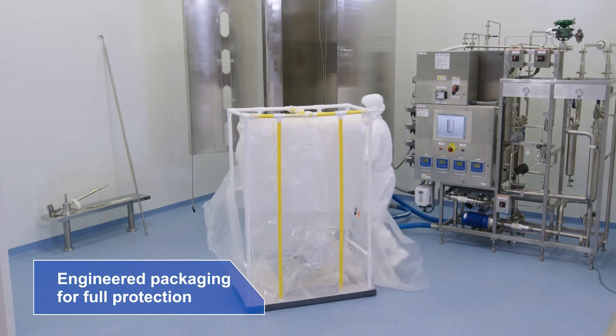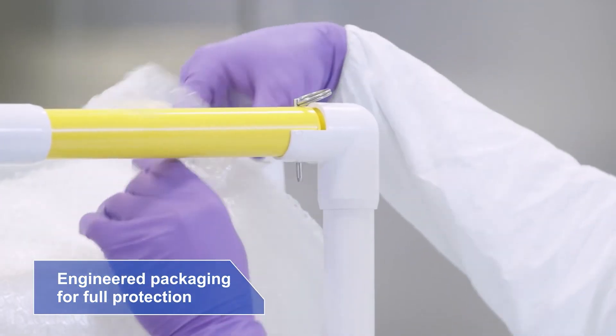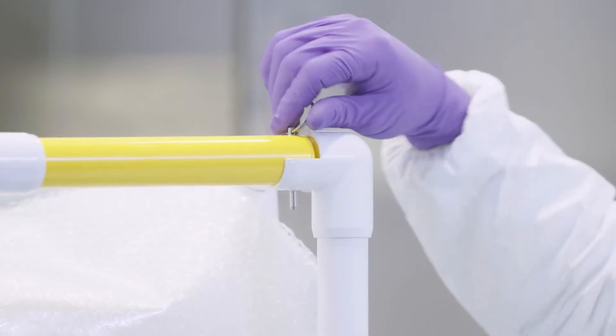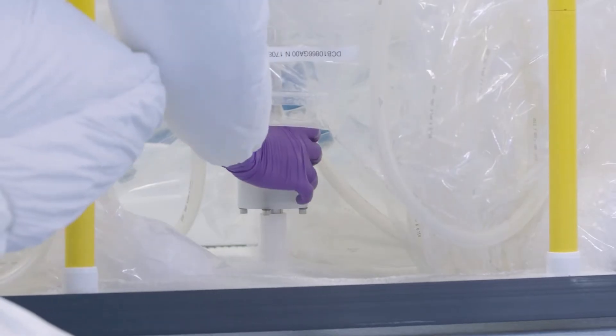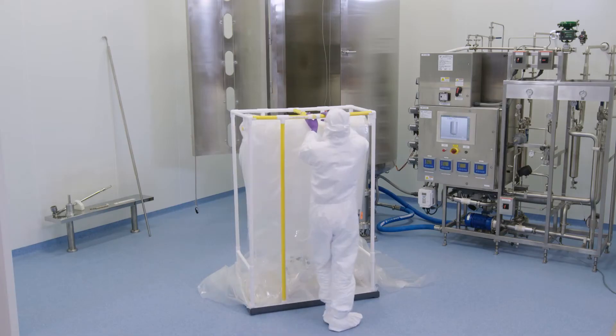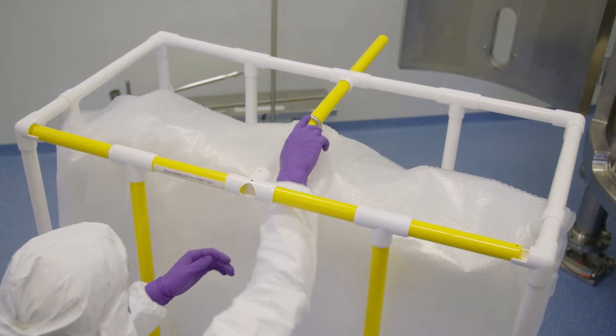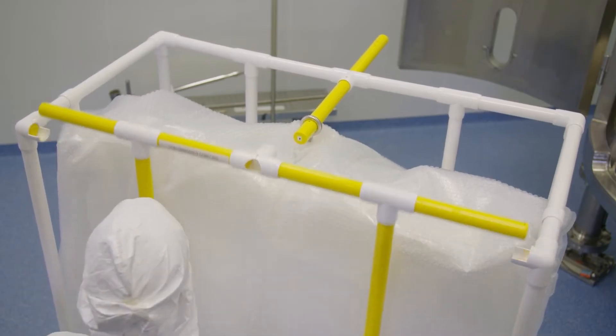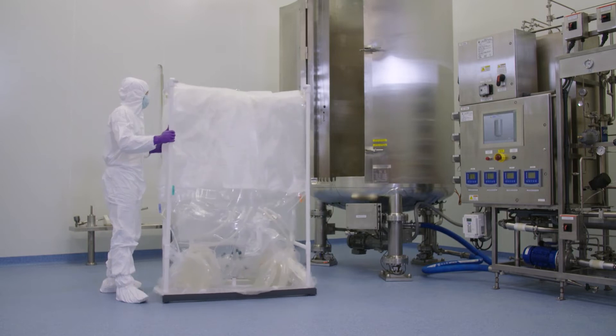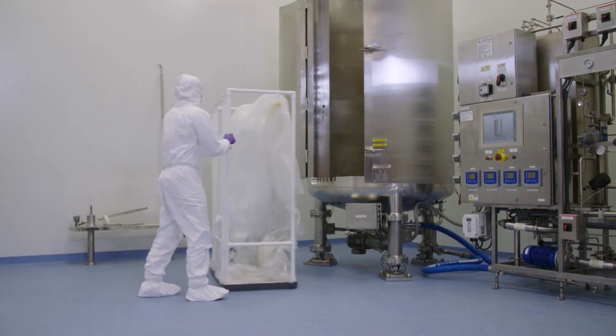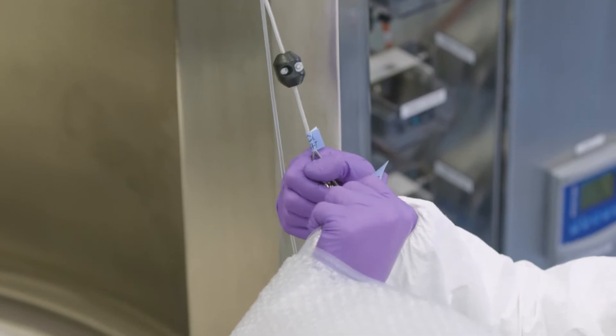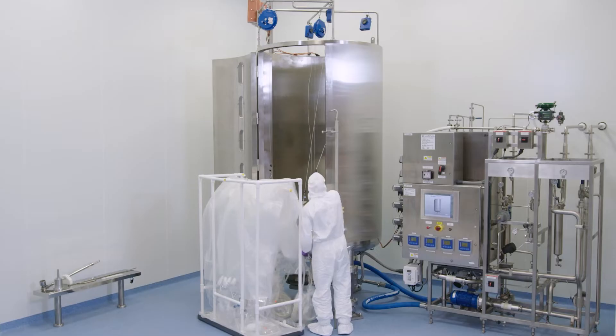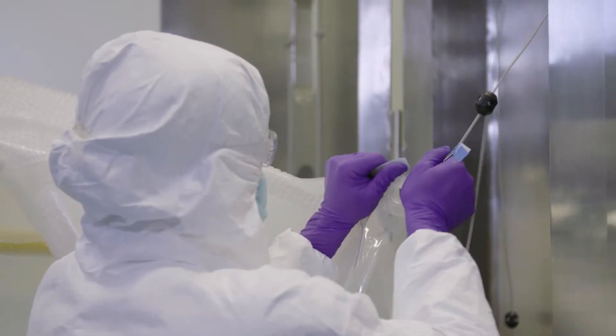Carefully constructed and designed packaging eliminates damage during transportation protecting the film. Yellow tubing clearly identifies the components to be removed to prep the disposable container for loading. Attach tool balancers to assist in the disposable container installation.